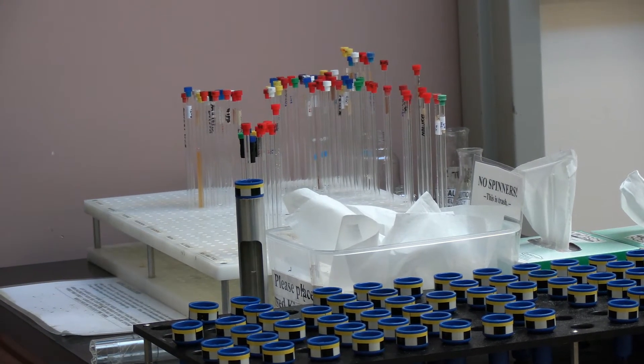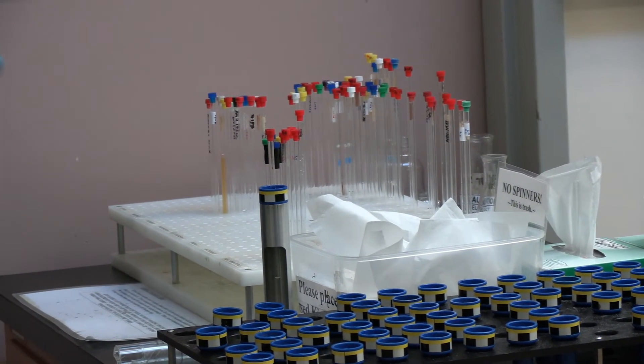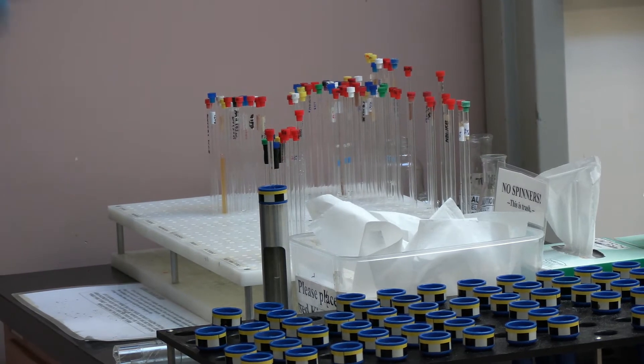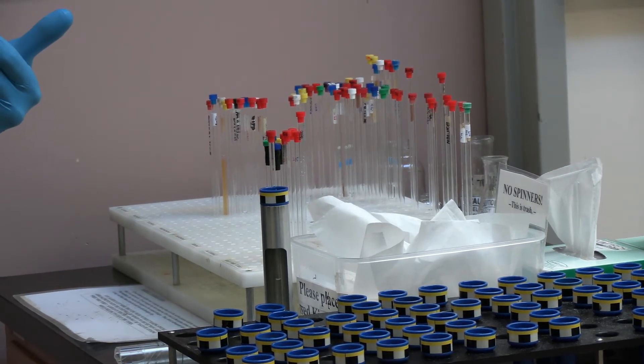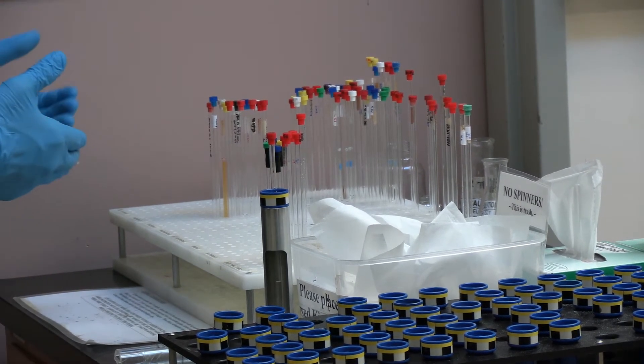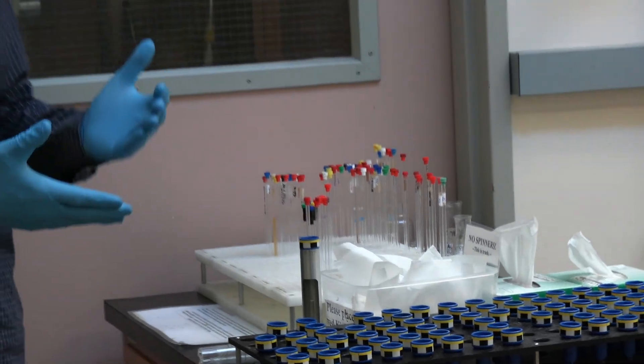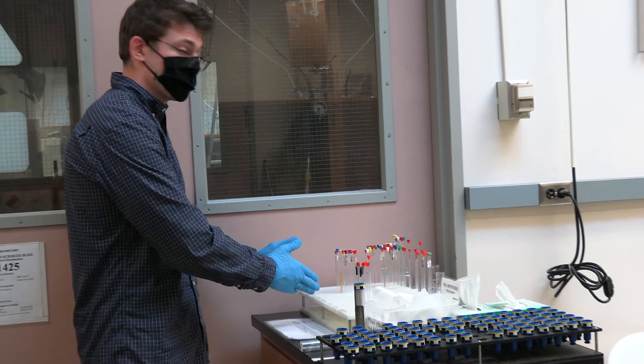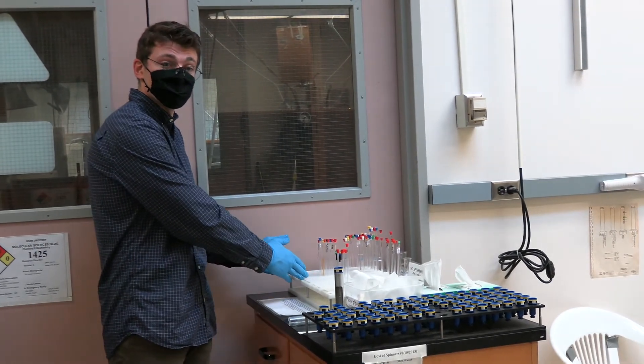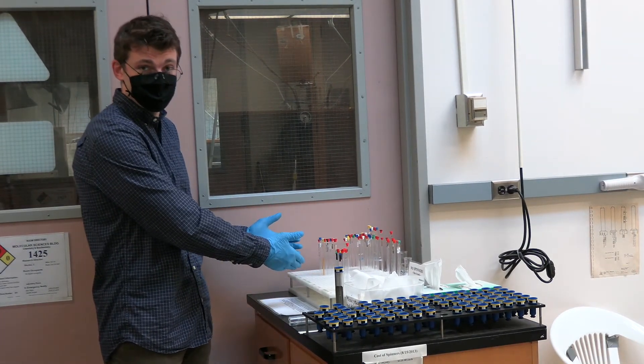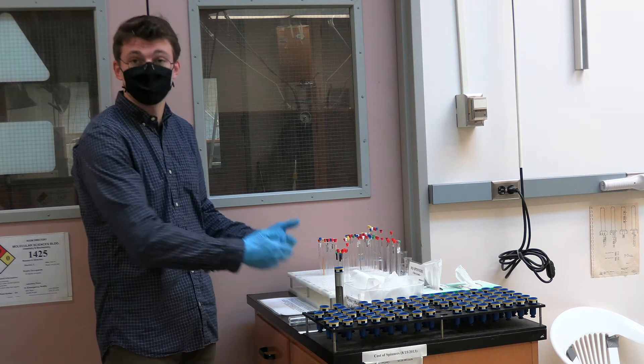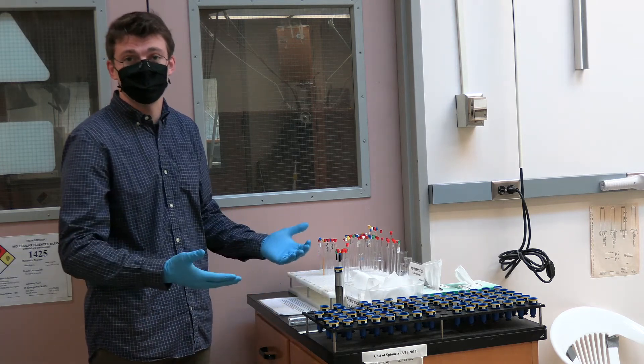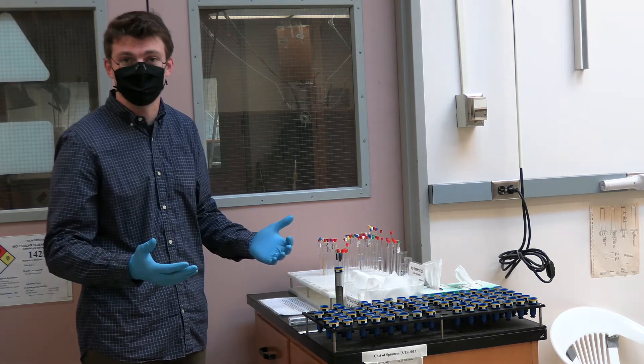To ensure that the carousel does not fill up completely, the samples are removed and placed on the sample rack every morning. These samples are placed in the bin labeled with the day of the week they were taken down. If you come looking for your samples the day after acquiring your data know that they will likely be somewhere on this rack. In addition if you do not pick up your samples within one week they will be donated to a graduate student in need on a first come first serve basis.